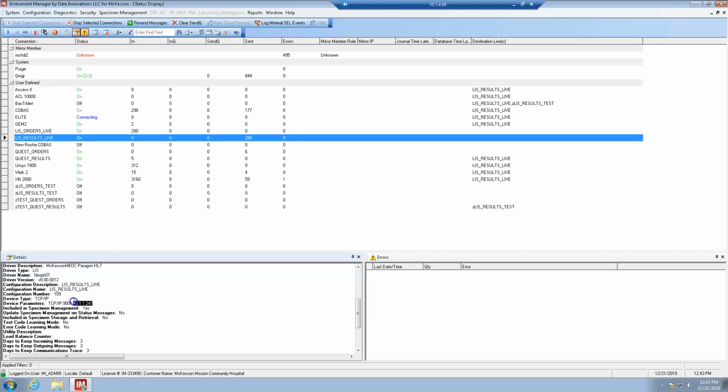Okay, again, obviously if we make big changes, we notify one another, but there was a time where all of a sudden the IP changed, so it's good to check to make sure that this IP is correct here. Okay, so that's the first step.